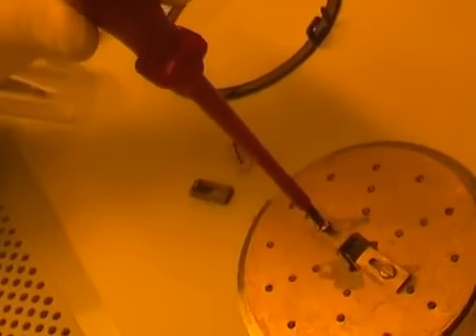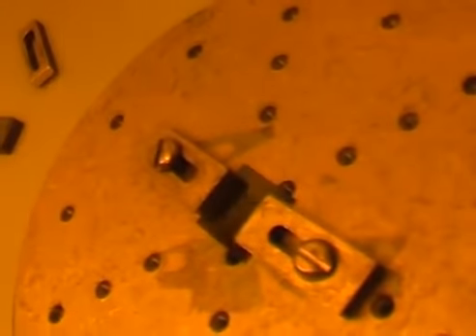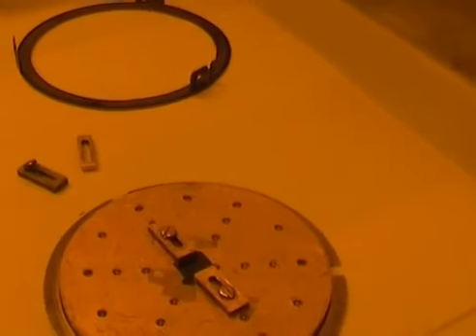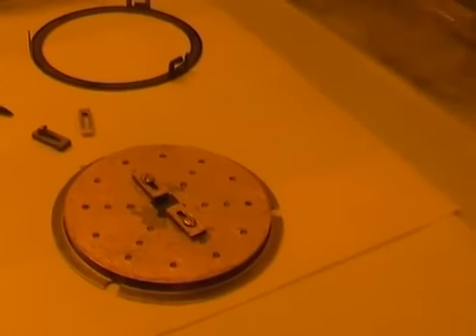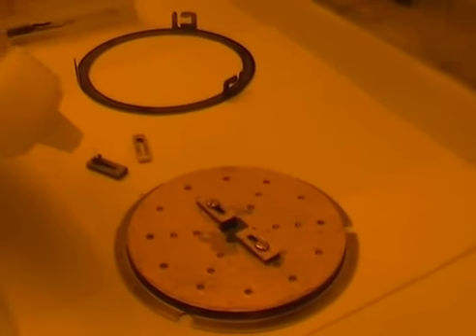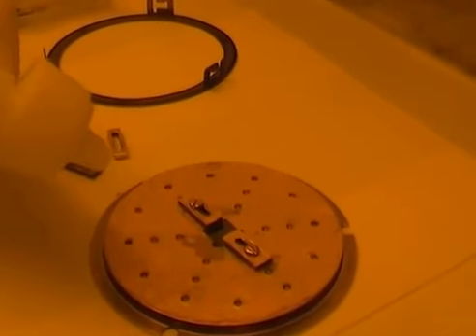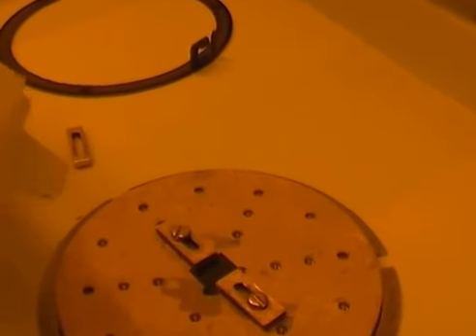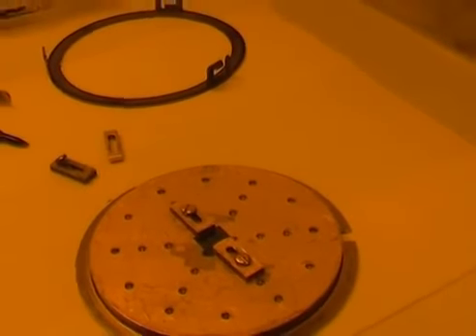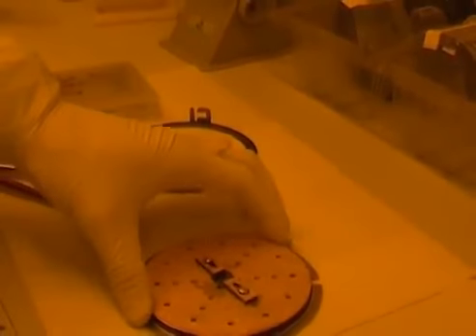Okay, so now my sample is ready for metal deposition. And one good thing to do right before going and loading the sample in the load lock is to check with the nitrogen gun if the sample is steadied in place. So if I give a good blow of nitrogen with the nitrogen gun and I see that the sample doesn't move, that means that probably it is not going to move during the metal evaporation.